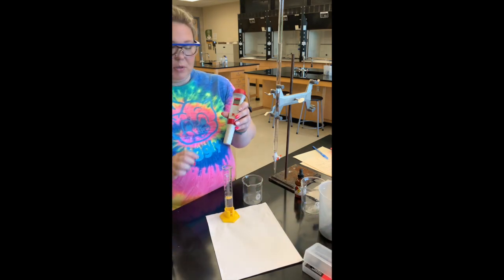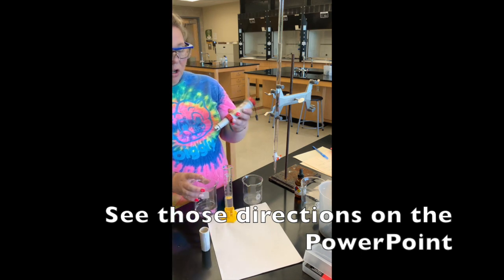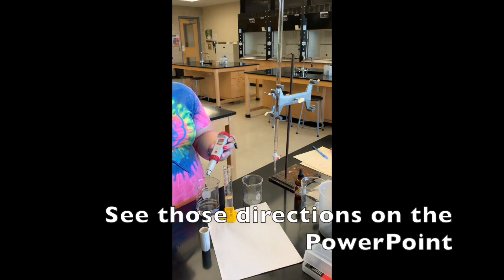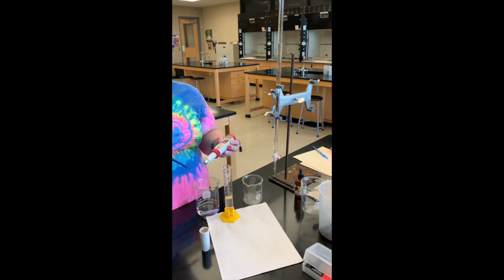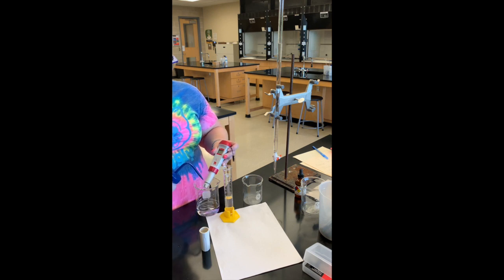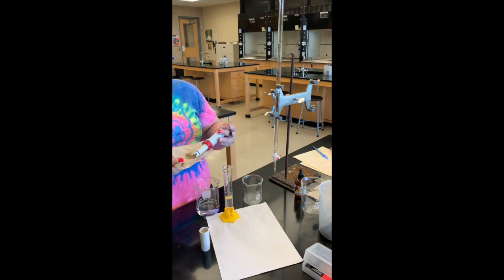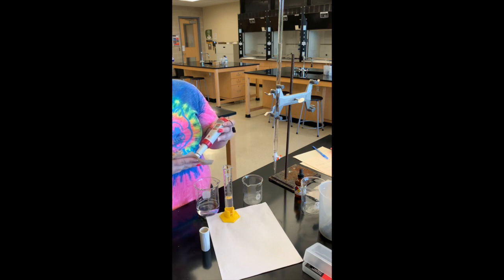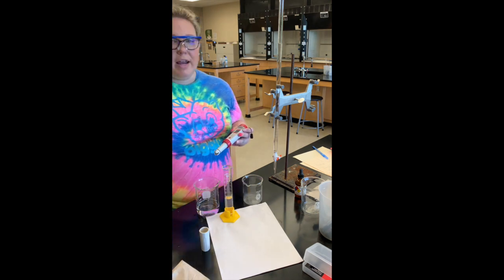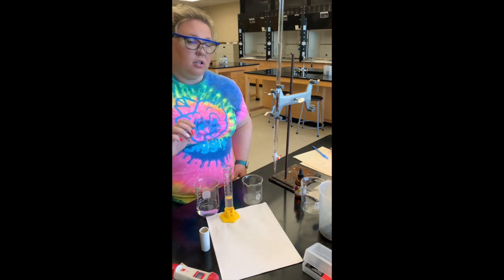I have my pH meter ready. To use it, you want to rinse it before use — it has a glass electrode which is very fragile, so please be very gentle. Just rinse it off before putting it in any solution, then gently dry it off. You want to rinse and dry it each time before using the pH meter.